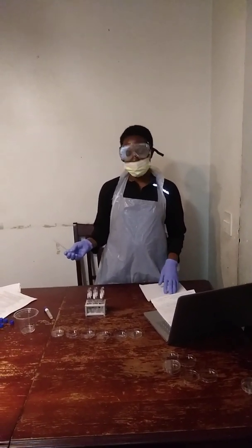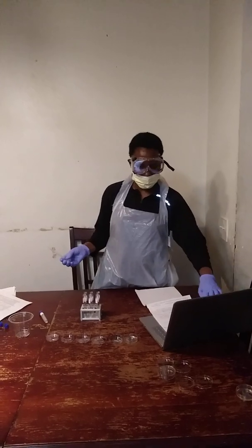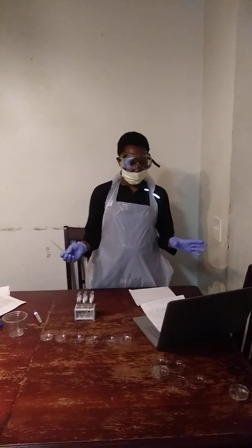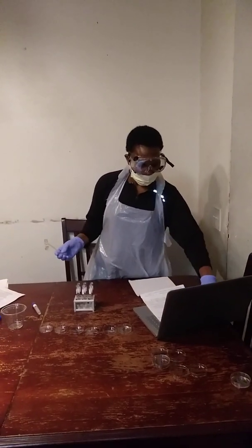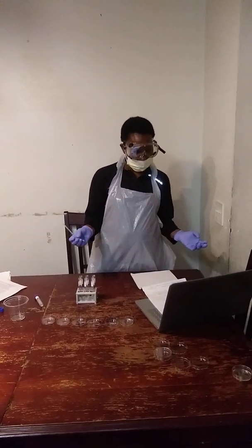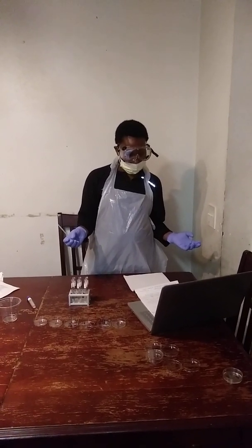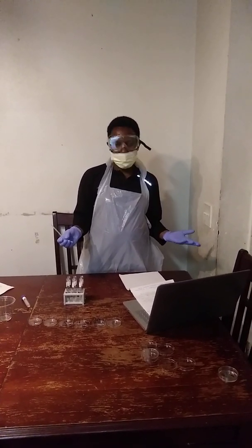So that is how we calculate for determining what plate to count, and then calculating the concentration thereof. Thank you.